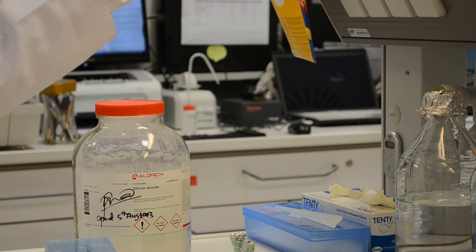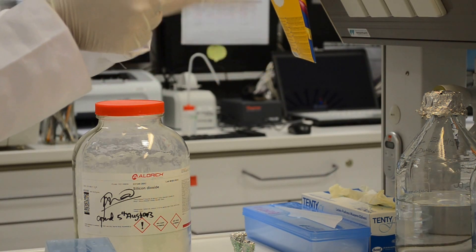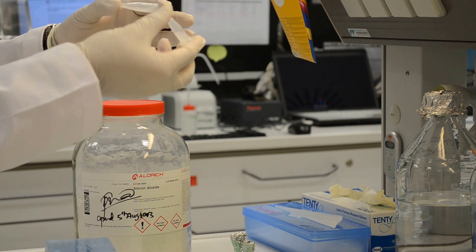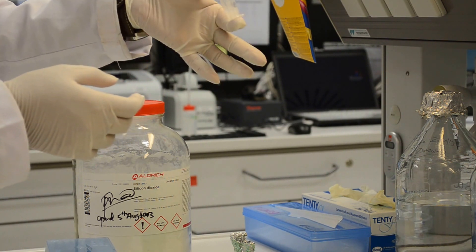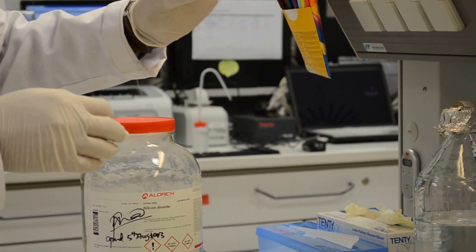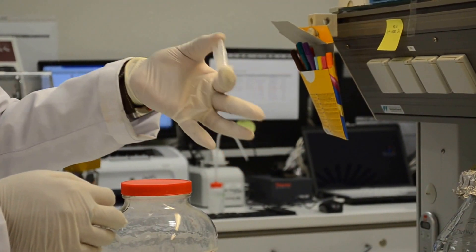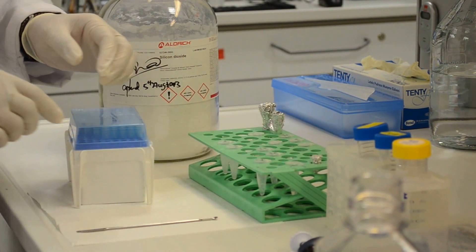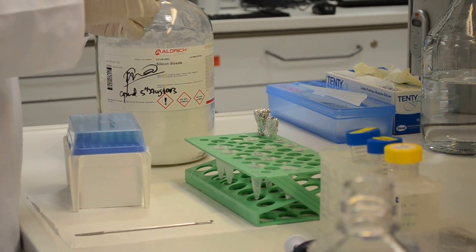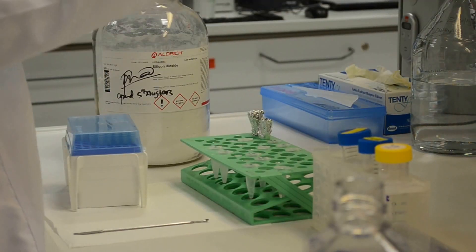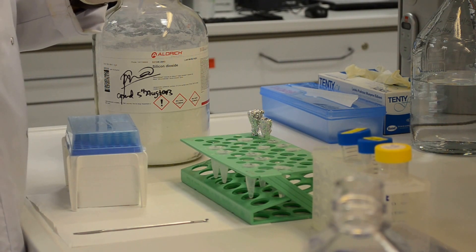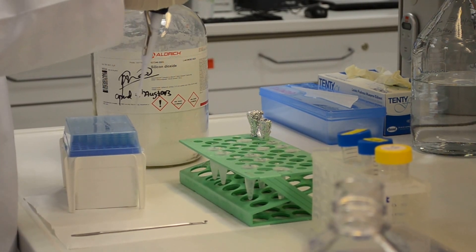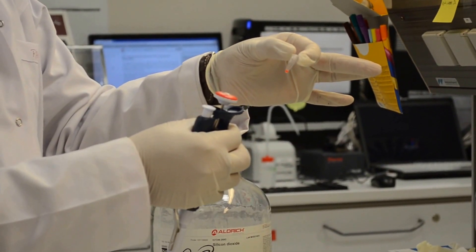A known quantity of quantum dots will be suspended into this silica suspension. A known quantity of quantum dots will be added to this suspension and we will see a bright red color fluorescent once we expose it to the UV light. That's the color we can see.